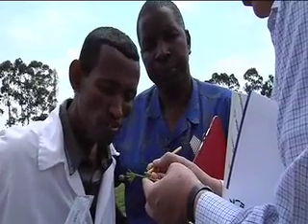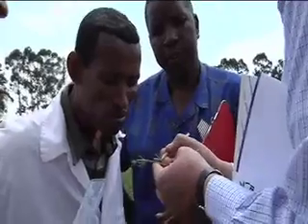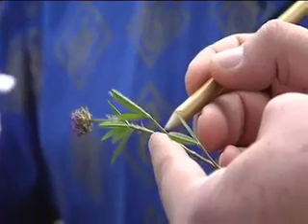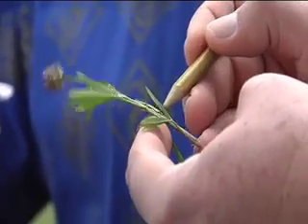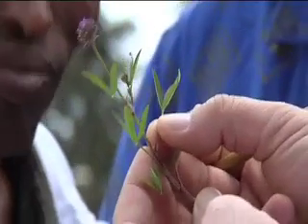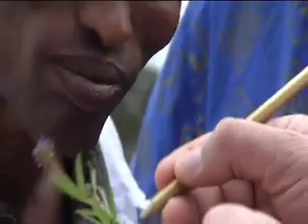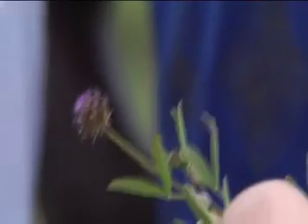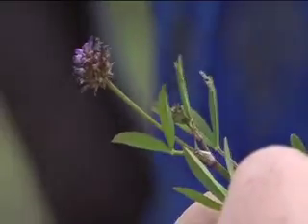This is called a stipule. When you do the measurement, the stipule is measured from here to here, from top to bottom. This is called a petiole — the stem which holds the leaflet. This is a compound leaf, specifically a trifoliate. The stipule is measured from here to here, the petiole from here to here, and then this is the leaflet. Normally we take the middle one, and the leaflet should be measured from the bottom to the end.